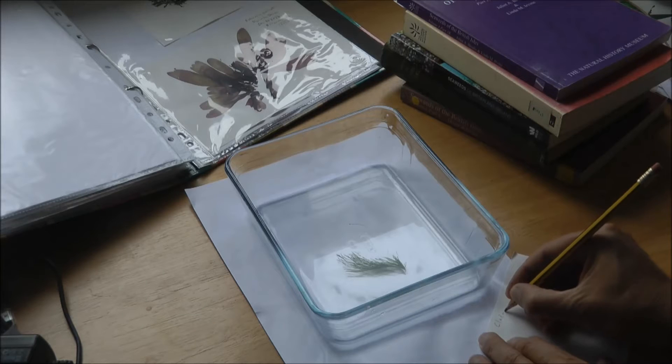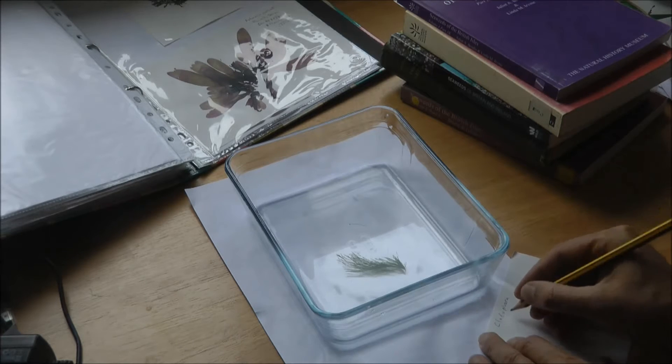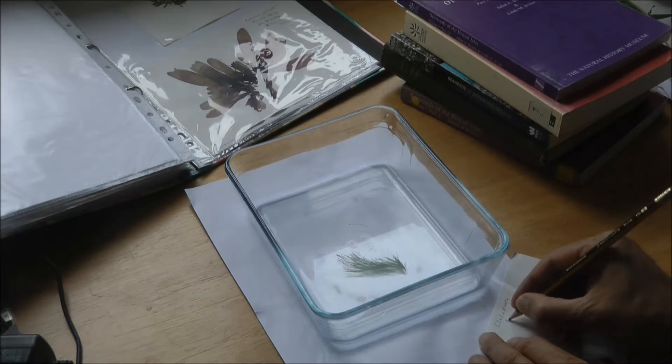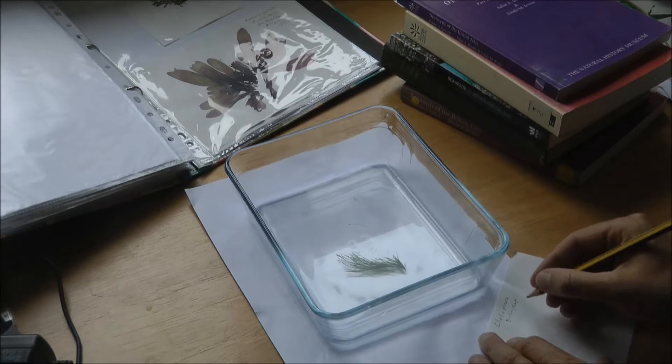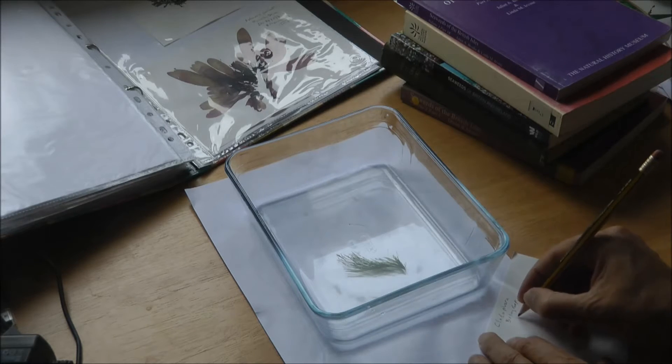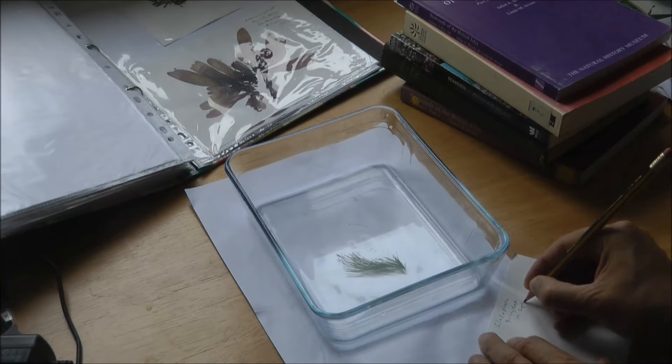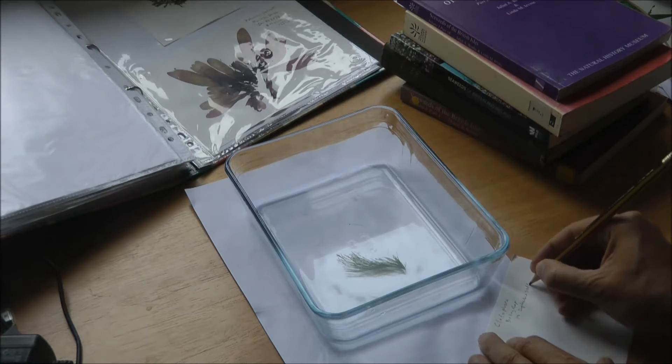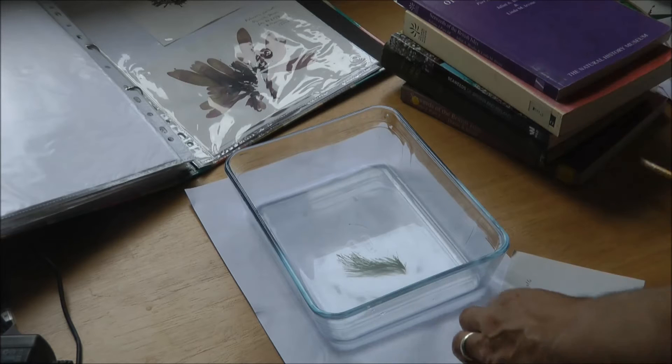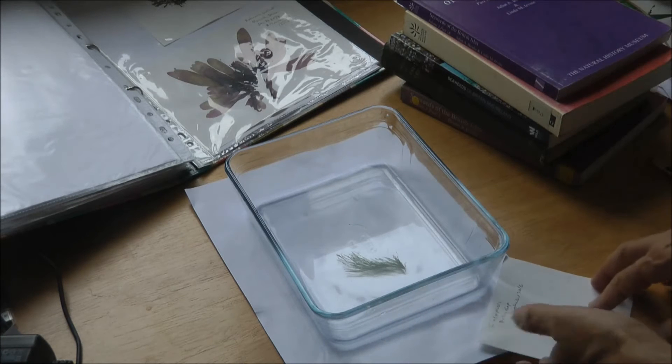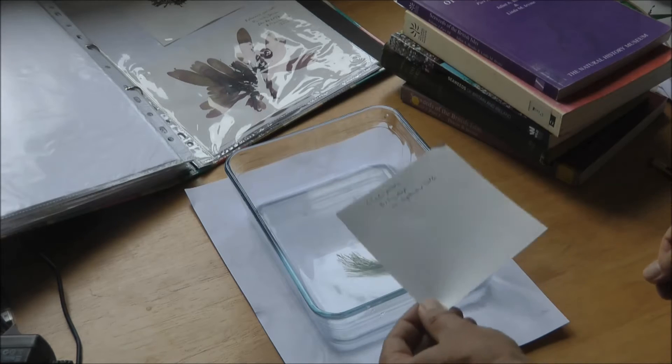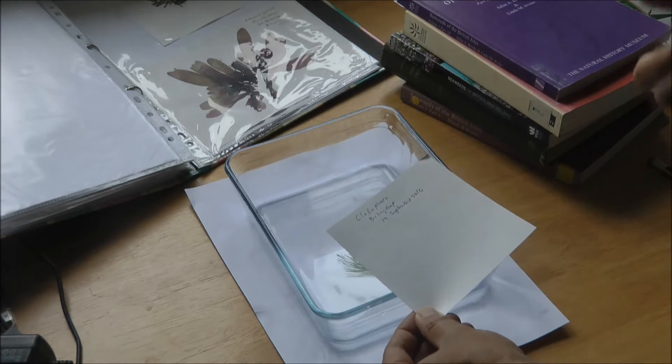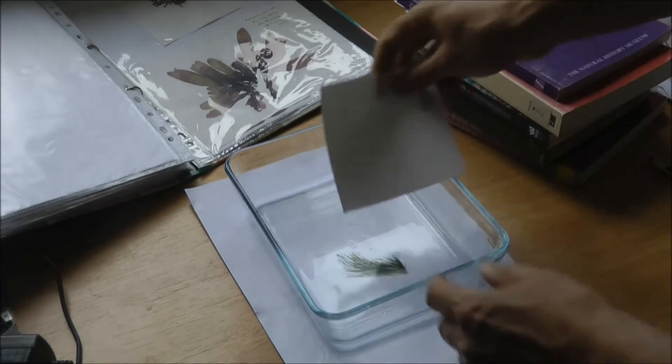Ideally you can write what it is if you know it, and ideally the place you found it and the date, and maybe your reference number if you want to relate it to your notebook if you took any notes. So now that you know what it is and you can match it up with your field notes, you can stick this in here and you need to get the whole paper wet like that.